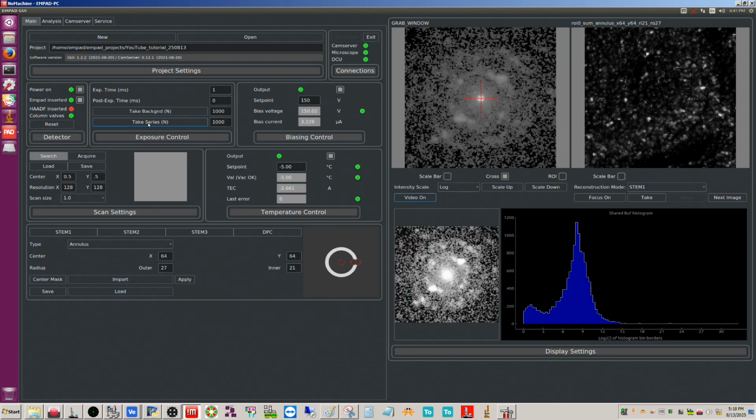You do have the option to just take a series. So basically, whatever your probe is doing, the probe is stationary. You can just take 1,000 DPs in quick succession right after each other, each one a 1 millisecond exposure. It doesn't do any kind of mapping, obviously, and the beam's not being scanned right now. So this is what I did when I collected the parallel beam patterns for doing the calibration. I did a take series.